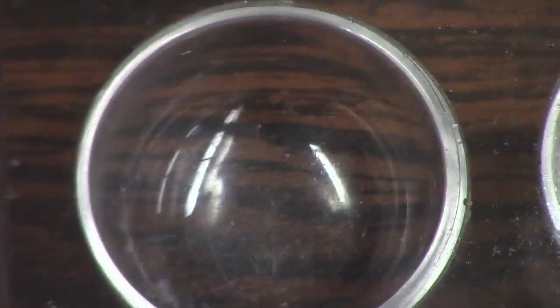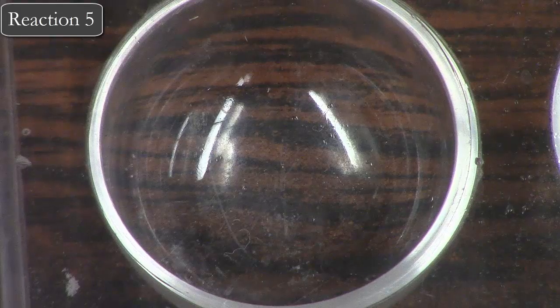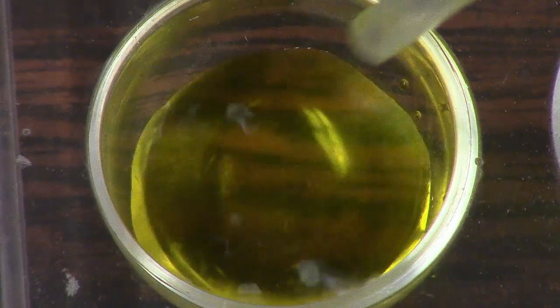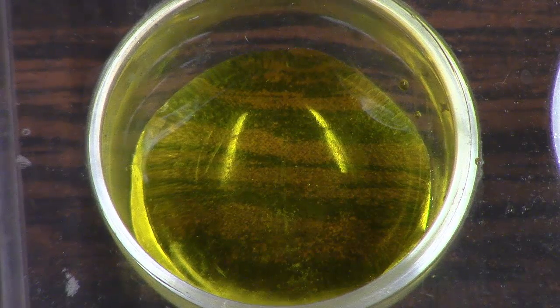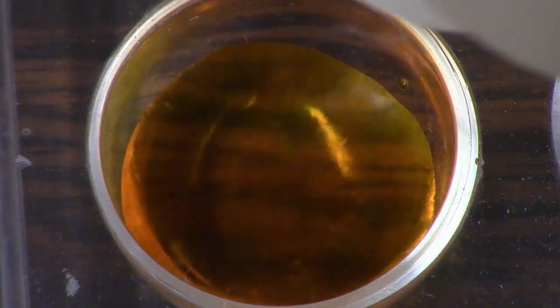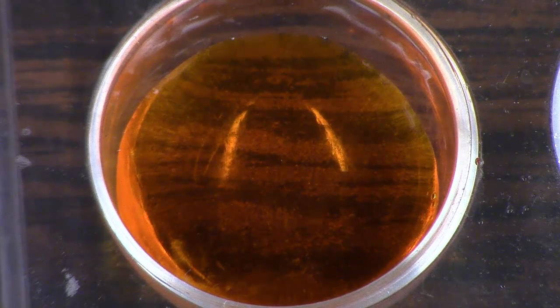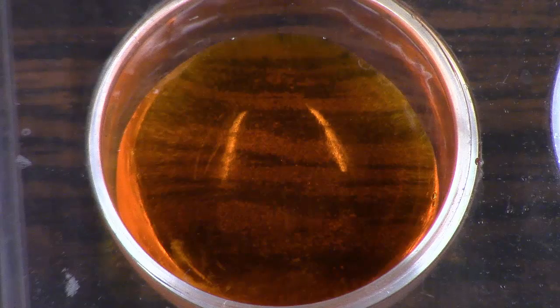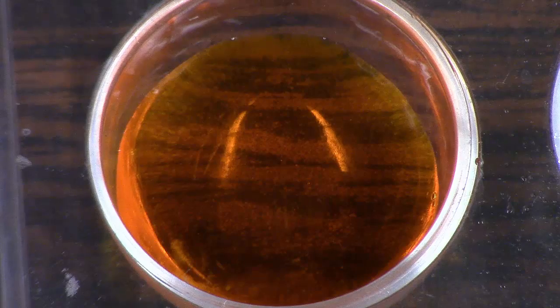We are on station 5 now, and we're going to be doing potassium chromate, which is a cool solution with a nice yellow color. We're going to add some hydrochloric acid again. Watch this one very carefully. That's a very cool solution. For this one, I'm not going to get you to predict the products—it's a bit more complicated of a reaction, so I wrote the products out for you. But look at the signs of a chemical change.